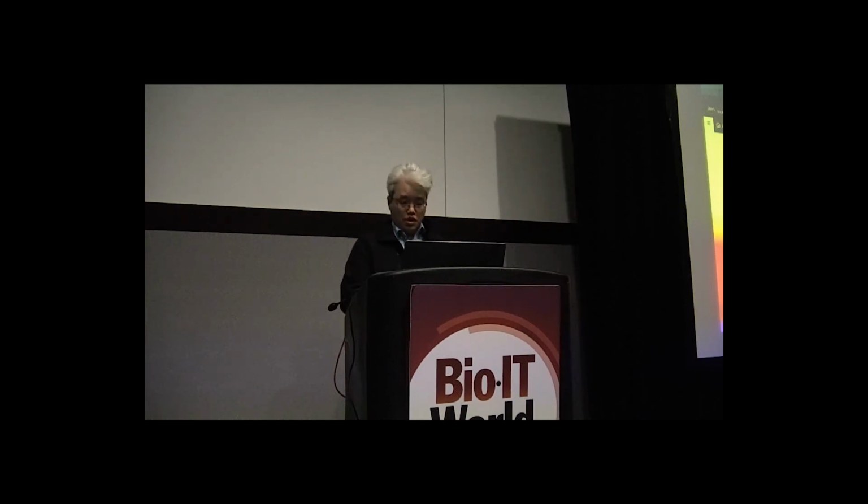One of the important things you might want to note is that there are a couple of URIs here that are unique to Omics. So there is this Omics URI that tells you what store it's related to and what ID this reference is. And this will come up later when we use workflows. You can actually point workflows to URIs like this to pull in the data. So you can use Omics end-to-end. All right, so that's all I want to get into.